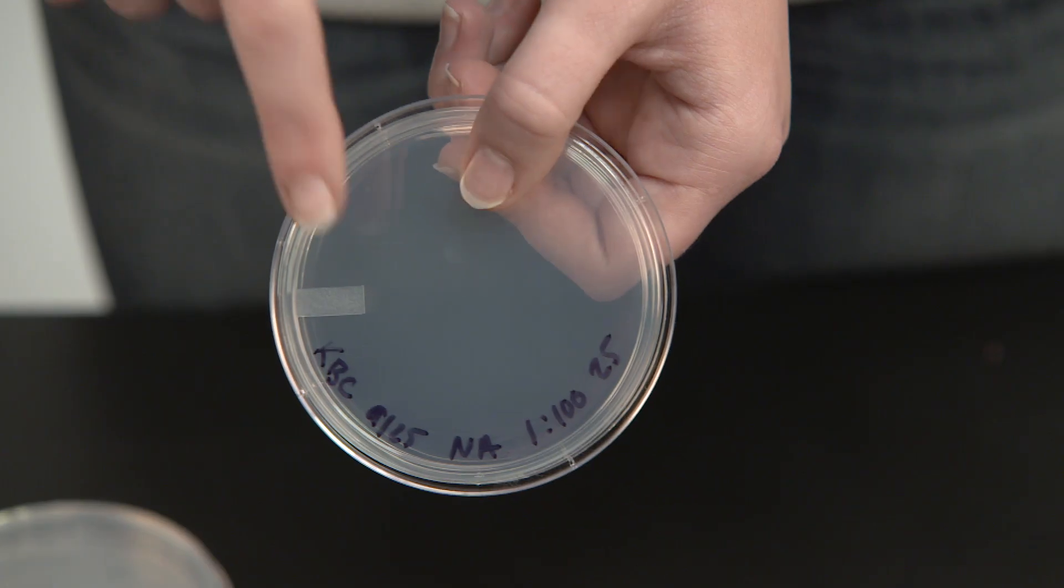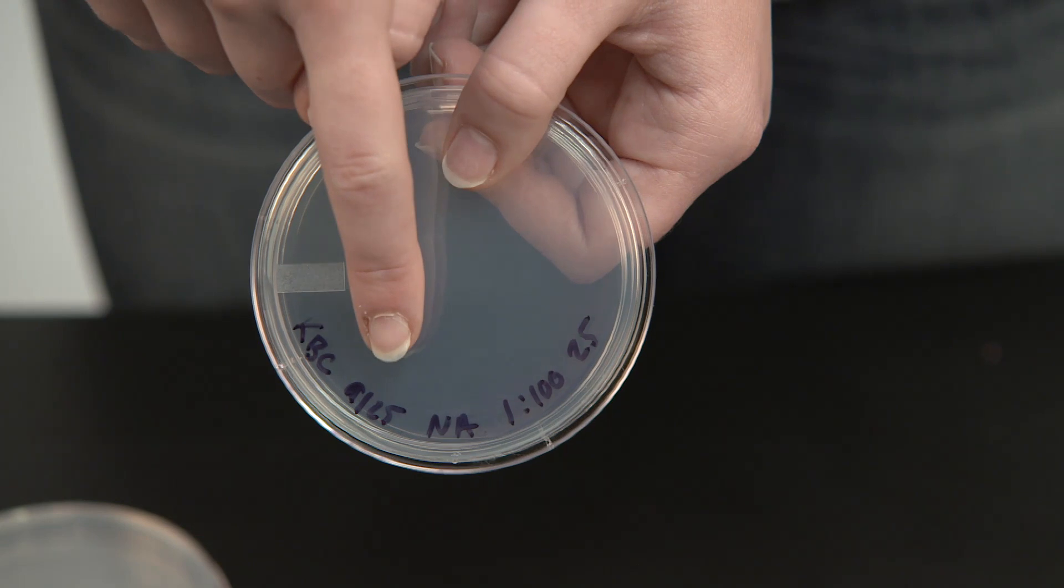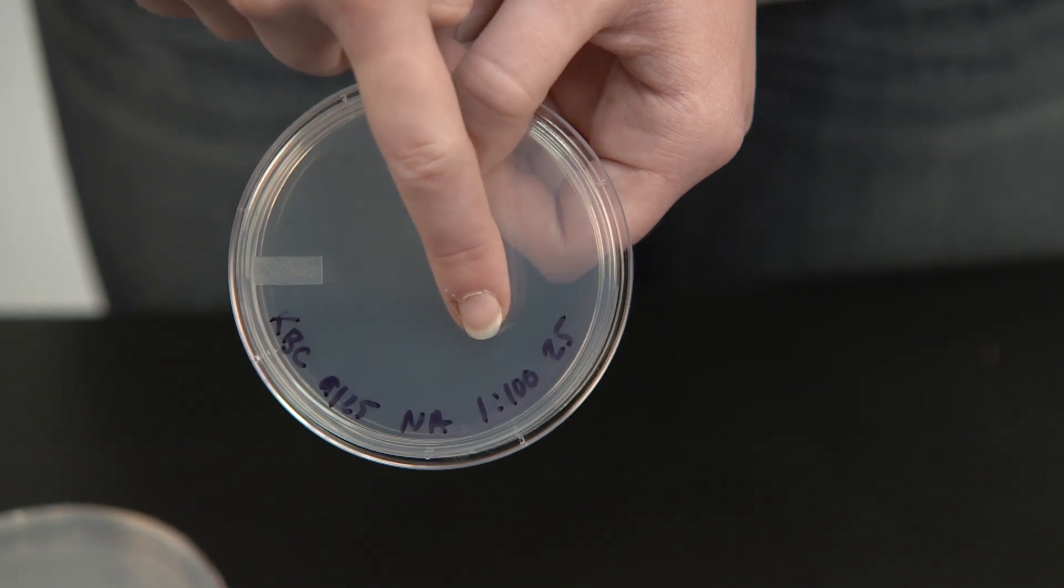Include your name or your initials, today's date, the type of media used, and the temperature at which you will incubate the plate.